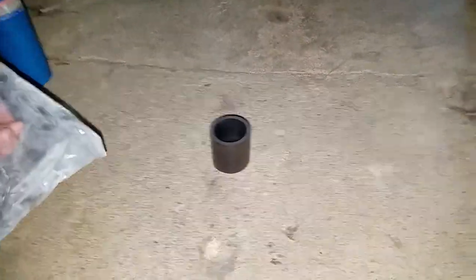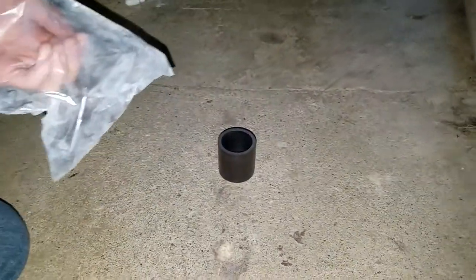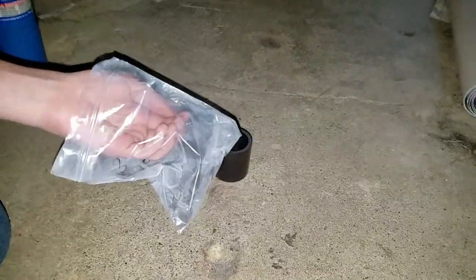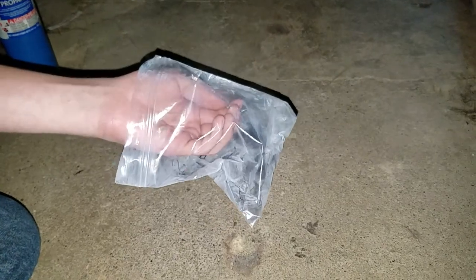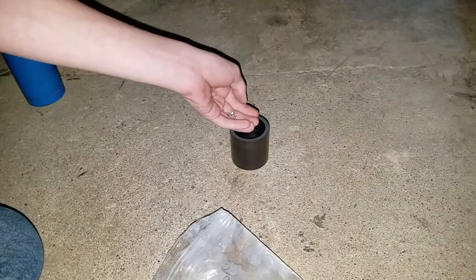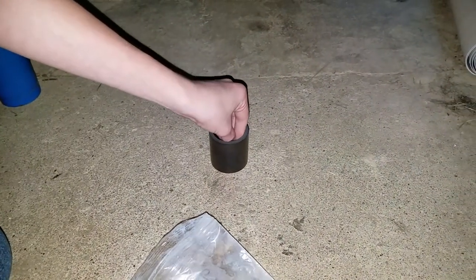What's up, guys? The real Damon Jackson here. And today I'm with my friend, Chopped Up Chopsticks. And I also have my hand in a bag, as you can see. So he bought this graphite crucible.